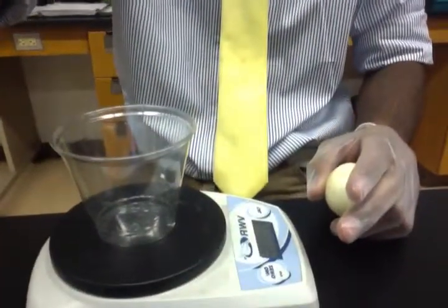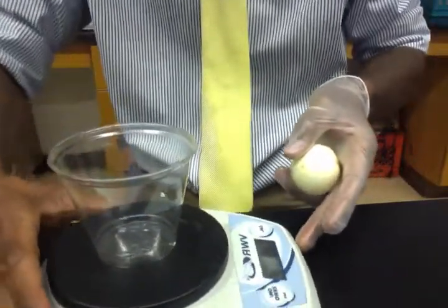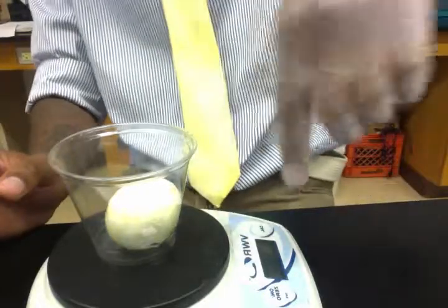Now, once you get the egg, we're going to mass it. So we're going to take the egg out the cup. Make sure, once we're measuring the cup, that we zero it out so that it equals 0, as you see, so that we don't take the mass of the cup. And now we get the mass of our egg. All right, so the mass of the egg is 58 grams. Make sure I write that down. This is going to be our salt solution, so write that down. Then everybody in the class is going to share their masses so that we have the mass of each egg. Once we do this, we can move on.